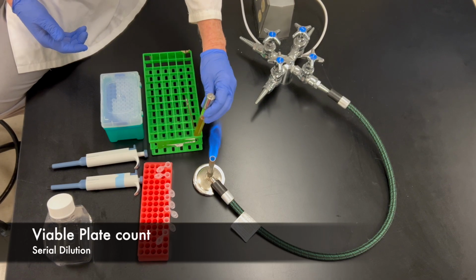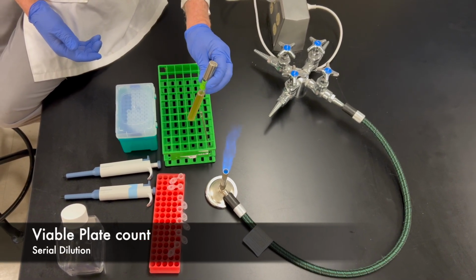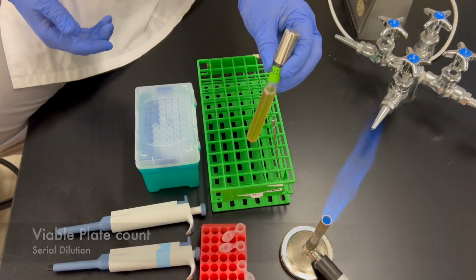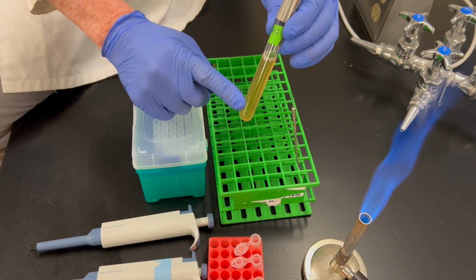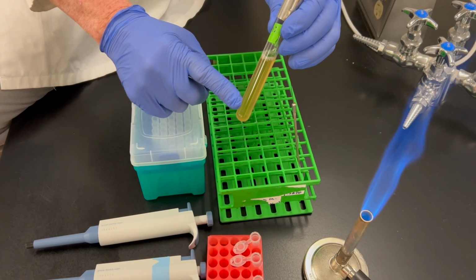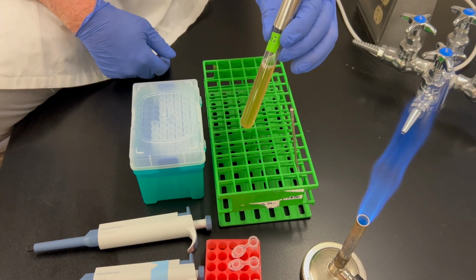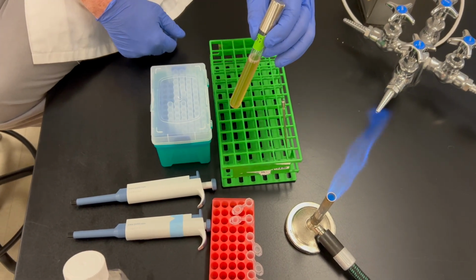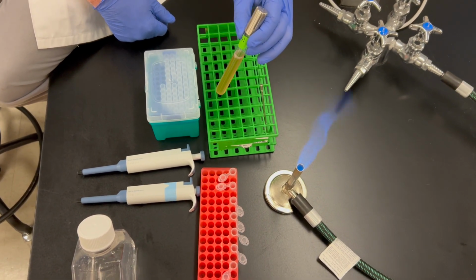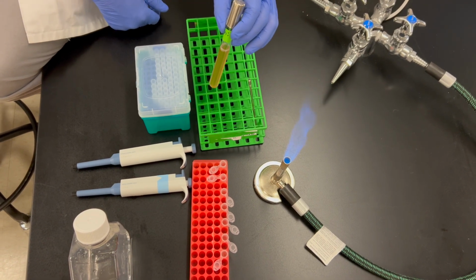Okay, so what we want to do with this video is show you how to do a standard plate count. What I have here is a tube of E. coli. This E. coli was inoculated 20 hours ago. It's filled with bacteria. What we want to do is estimate the number of bacteria per ml in this tube.